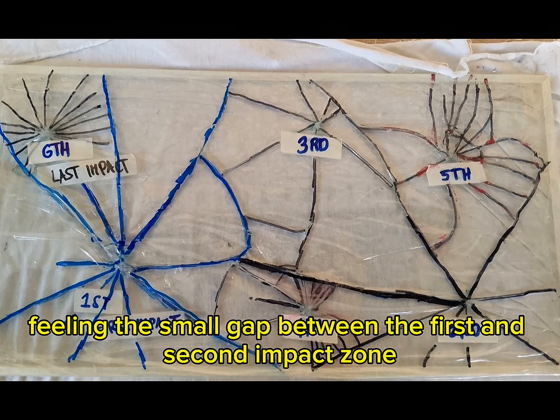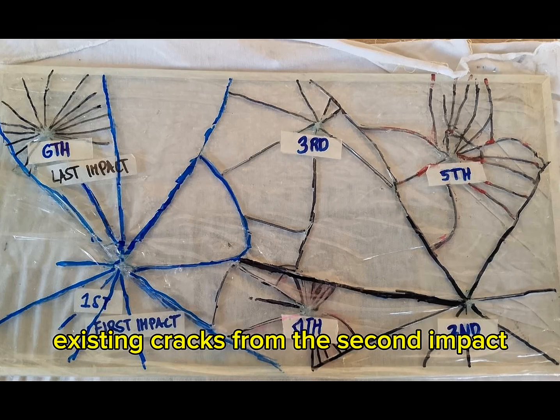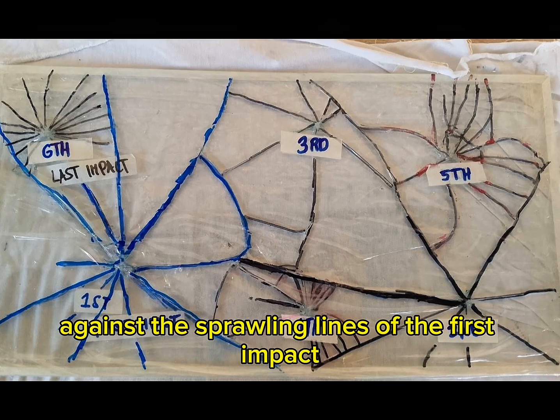The fourth impact, these concentric fractures are very tight and limited, filling the small gap between the first and second impact zone. The fifth impact, these fractures are stopped by the existing cracks from the second impact.